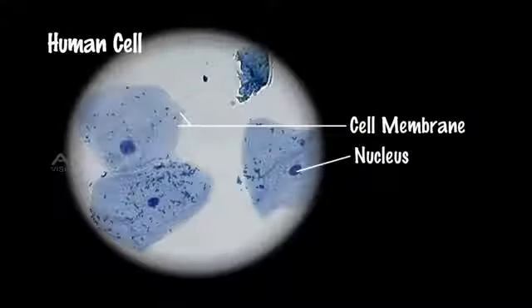Conclusion: if the cells observed do not have cell walls or prominent vacuoles, the cells of the specimen on the slide are animal cells.